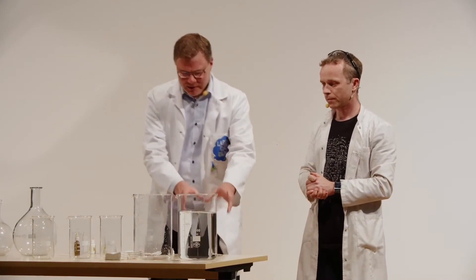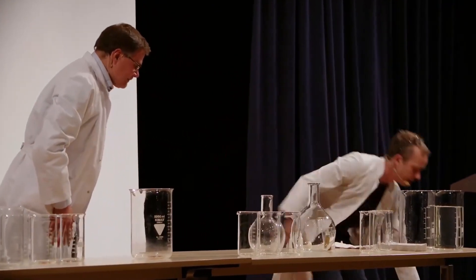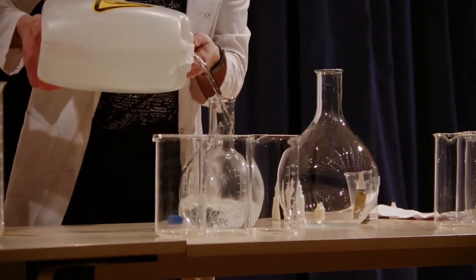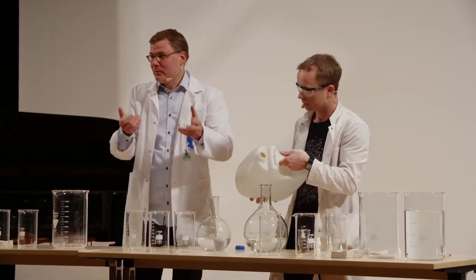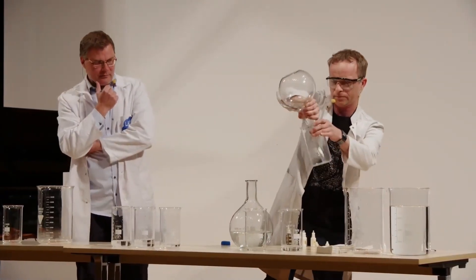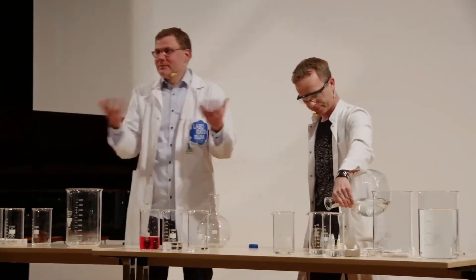To see better what's going on, because this color could be a bit brighter, that's the reason why we put more glasses here so you can see better from the back as well. Same liquid, pour inside. But if you want to mix, because from one liquid you can't get a reaction so easily — that's the reason why we have two flasks. We pour into flasks and then we can mix them. Because if you add another chemical, then you can have a sign of chemical reaction.